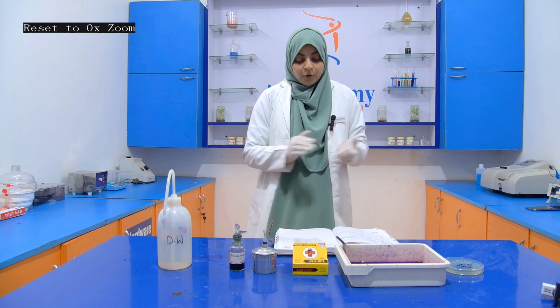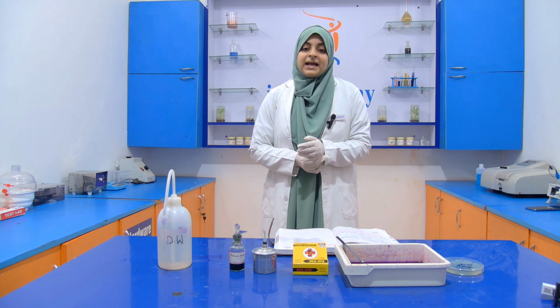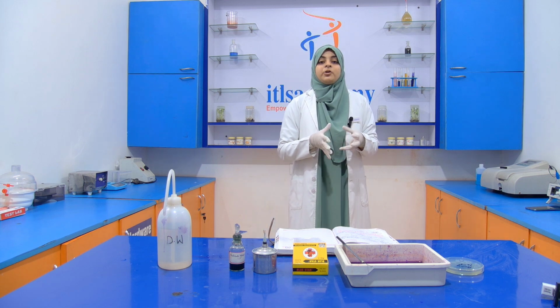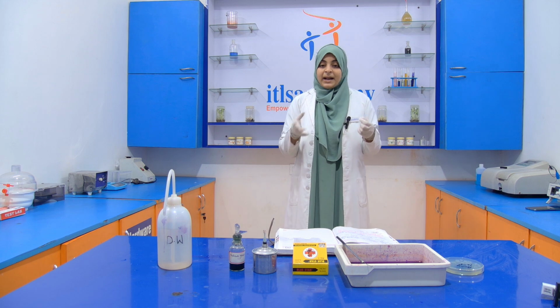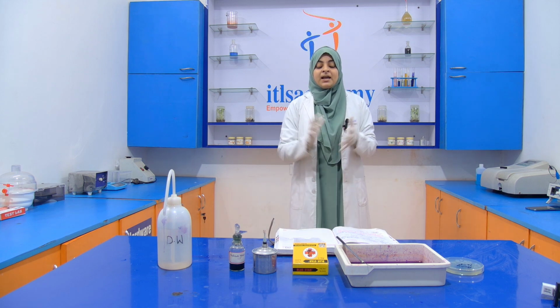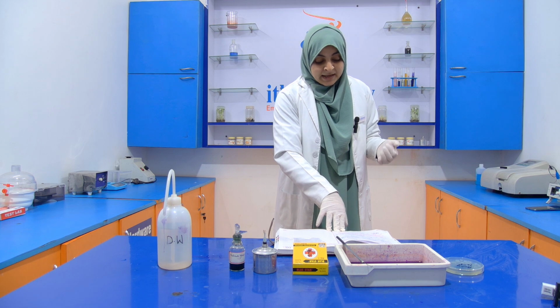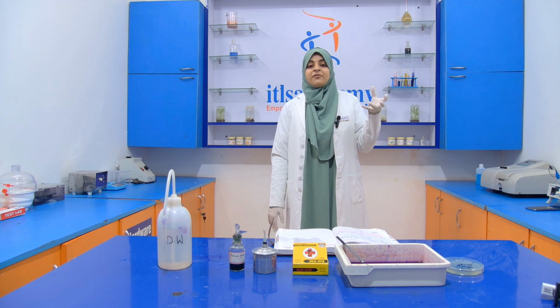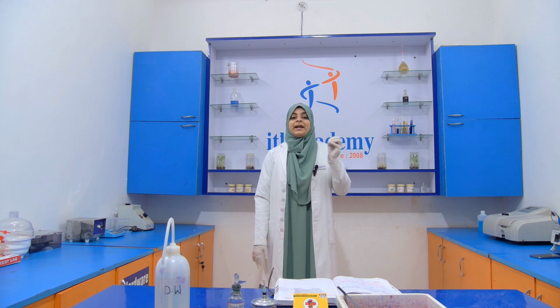Malachite green is water soluble and has very low affinity for cellular material, so a vegetative cell may decolorize with water, and again we use safranin. Safranin acts as a secondary stain, also known as a counterstain, for any cell which has been decolorized. The cells decolorized by the distilled water will be colorized with the help of the safranin. That is all about the endospore staining.